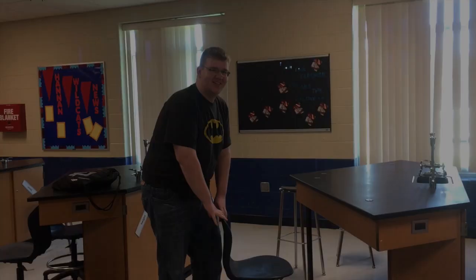Get down from there. Are you tired of tripping over backpacks and chairs in the lab and breaking your arm? By keeping aisles clear and pushing in your chair, your arms are safe from danger.